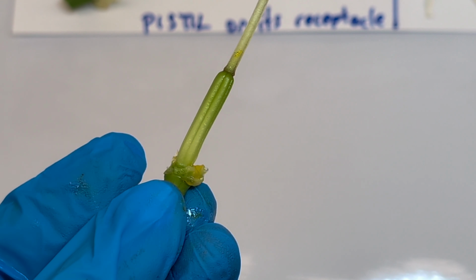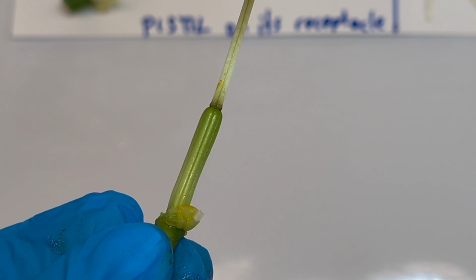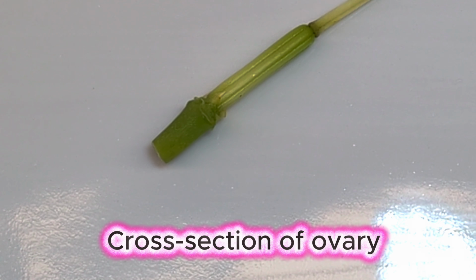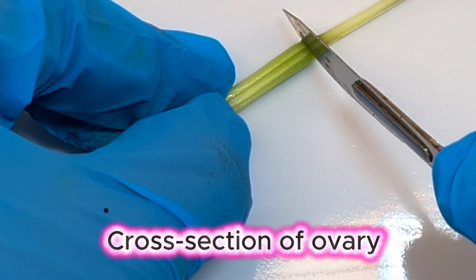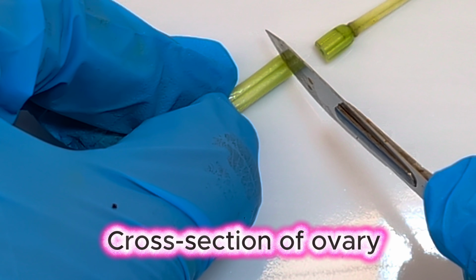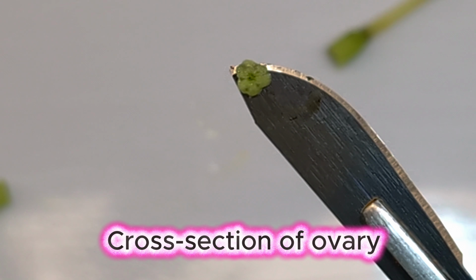Now, in order to see the ovules, we need to cut open the ovary. This can be done either lengthwise or via cross-section. I'm going to do mine via cross-section. So to cut a cross-section, maybe let's do it here. We just need a very, very thin slice across. So very thin slice across it.